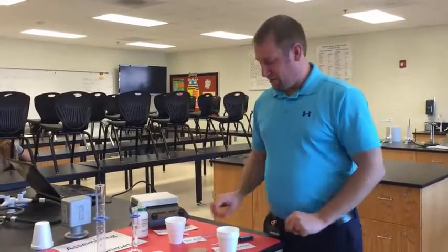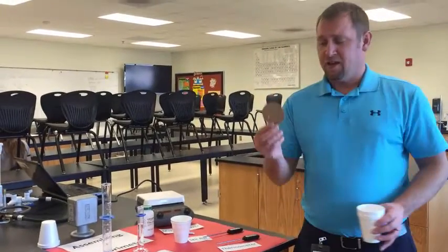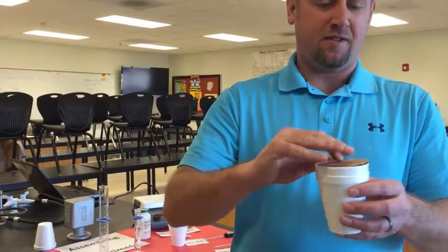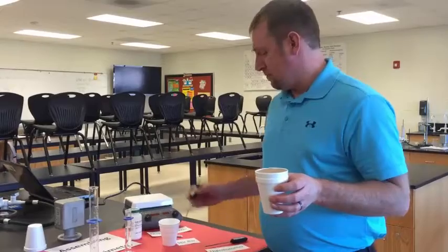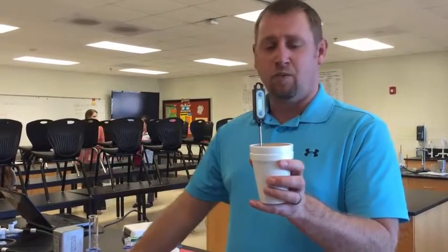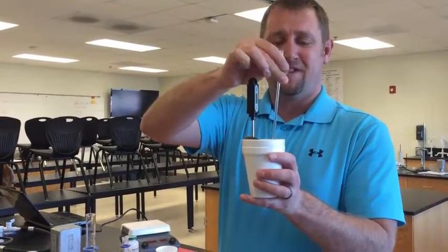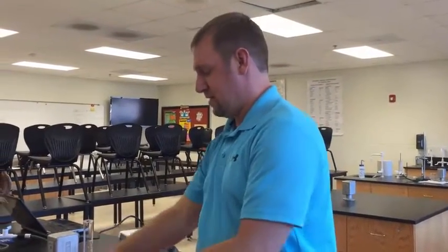The trick, however, is that we need to measure the temperature and be able to stir at the same time. We have pre-cut a cardboard disc that will fit perfectly on top of the calorimeter. There are two holes in the calorimeter: one for a thermometer to monitor the temperature, and one for a stir rod that you will use to stir the solution.